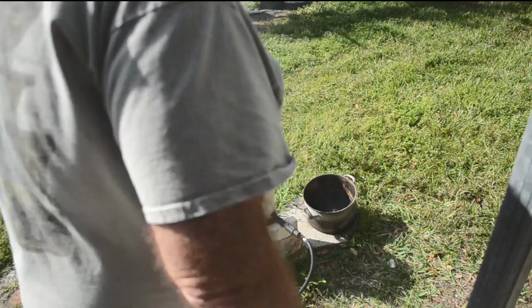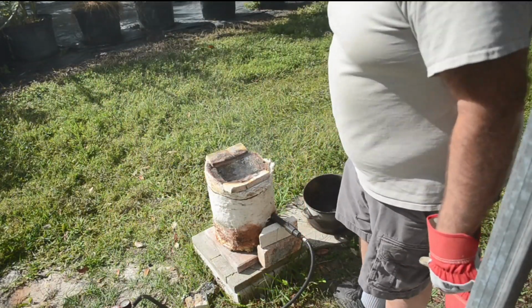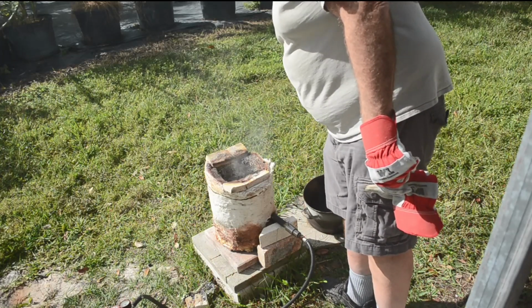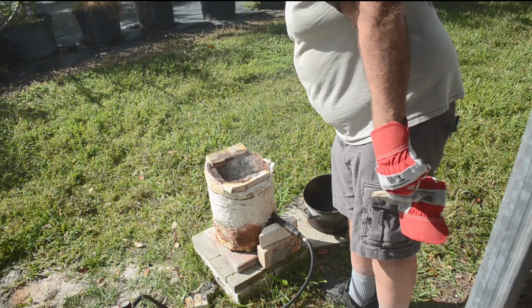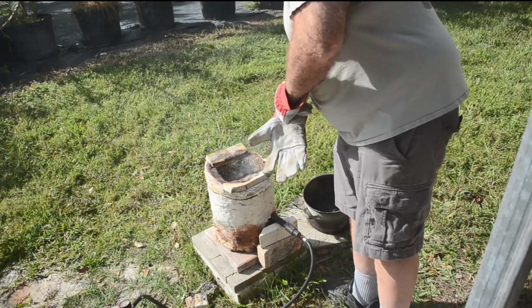So I guess we reached at least the softening point of stainless steel. Guess we're running a lot harder than I thought I was. Yeah, there's some slag down in there I'm going to have to recover, because it's probably got some precious metals in it.